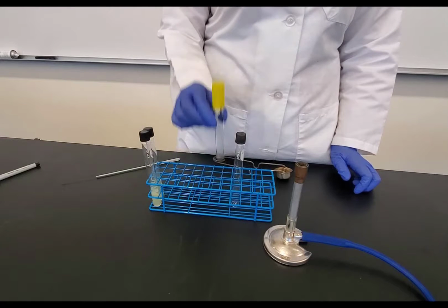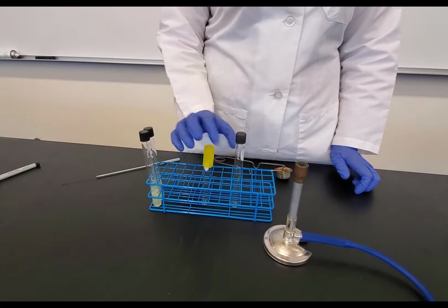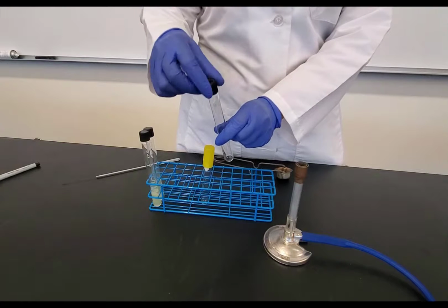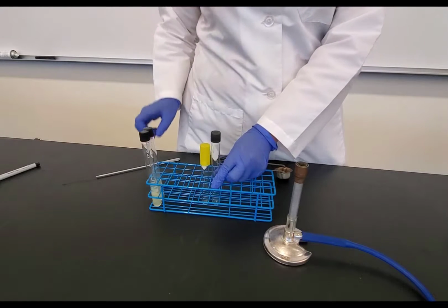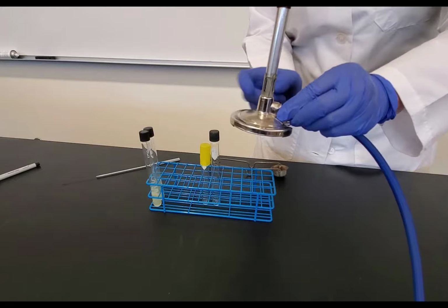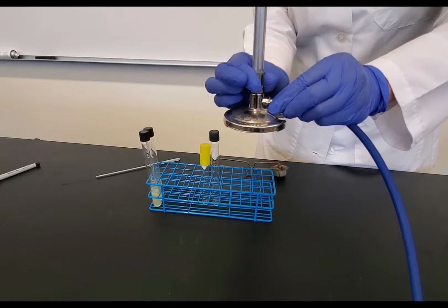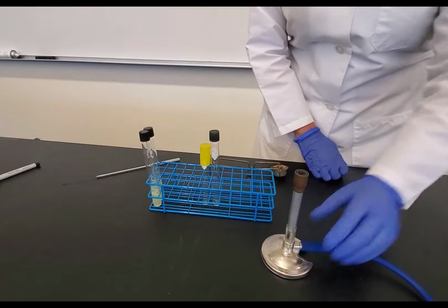So in this video, we're going to simulate transferring from the yellow cap tube into the screw top with the black cap. And before I begin, I'm going to loosen the black cap to make it easier to take it off when I'm working. So what I need to do is I need to get ready with the Bunsen burner, and I'm going to open the baffle. And that is going to allow air to flow through so that I can get a better flame.